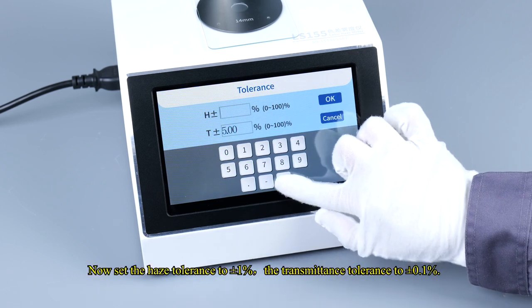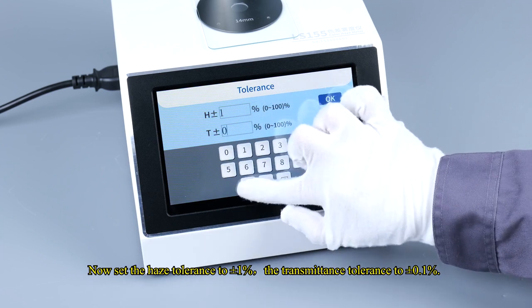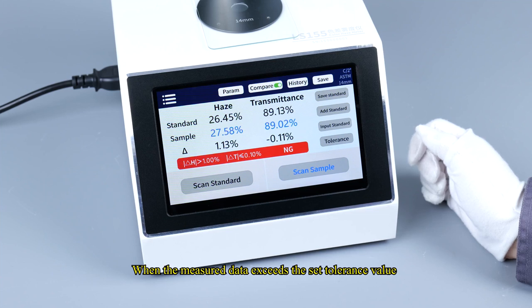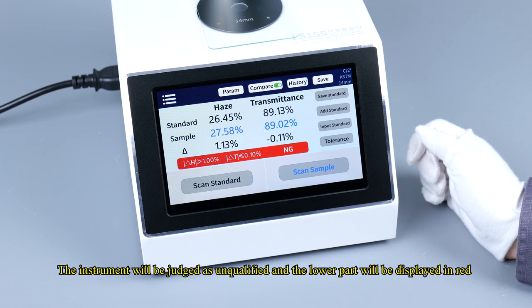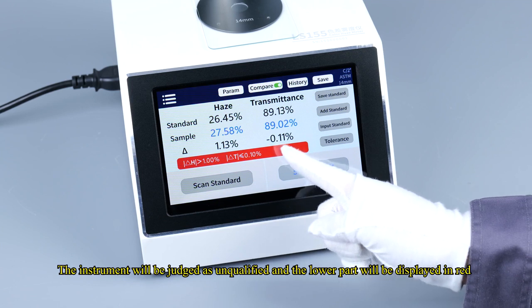Now set the haze tolerance to ±1%, the transmittance tolerance to ±0.1%. When the measured data exceeds the set tolerance value, the instrument will judge it as unqualified and the lower part will be displayed in red.